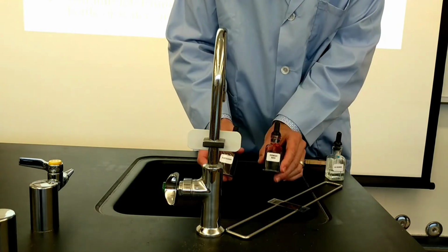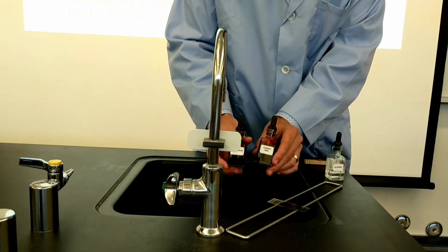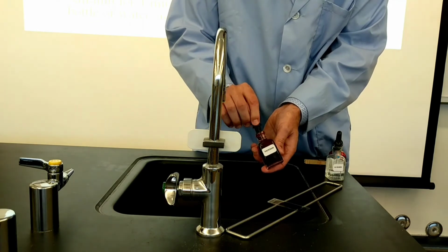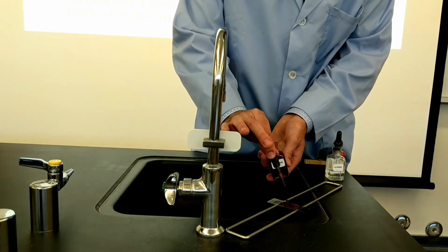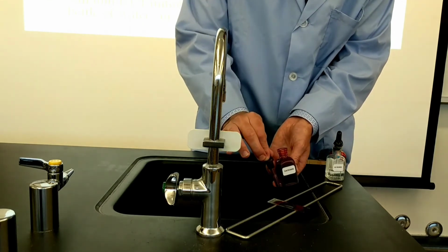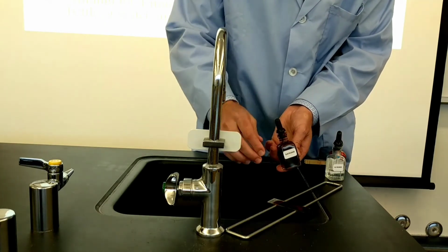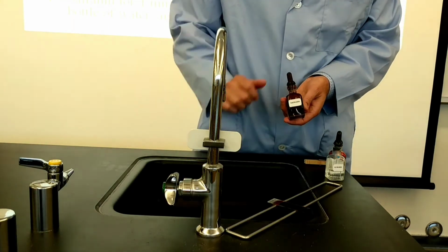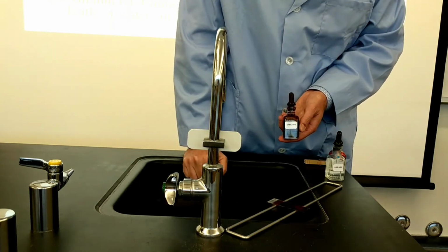Congo red is always the first step when you perform the negative stain, and then you put that aside. You want to make sure you grab this second type of red dye. It's a slightly different shade of red, a light reddish pink. What we're going to do is flood the entire smear. Be generous with these chemicals, guys. You don't want to hold off and put too little. So you cover the whole smear, and then you note what time it is on the clock. We need to let that soak for 1 minute.